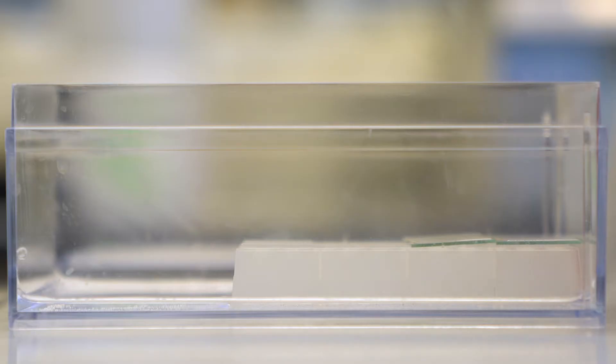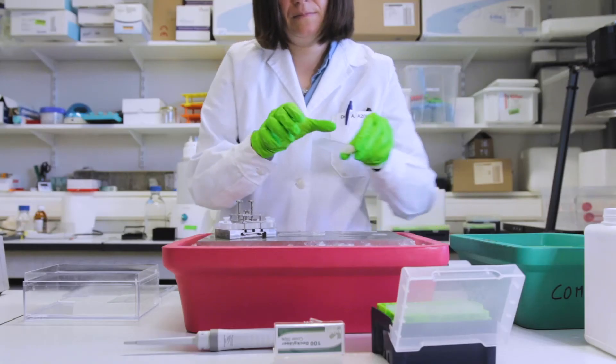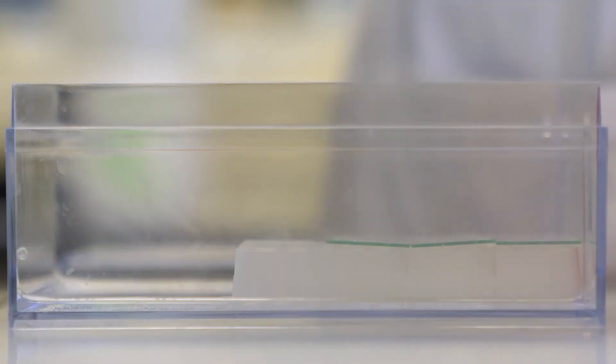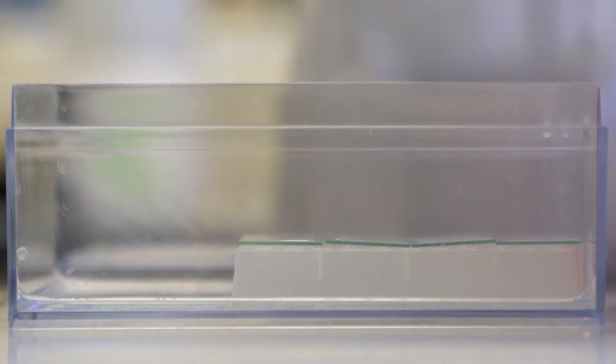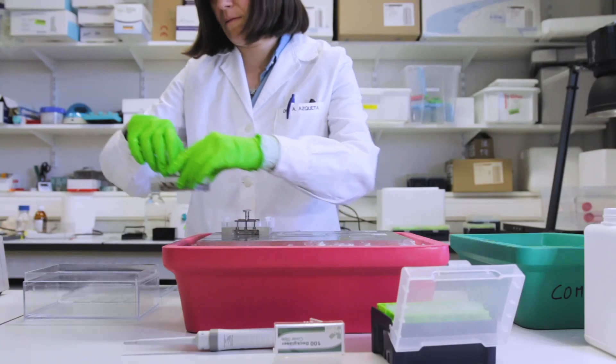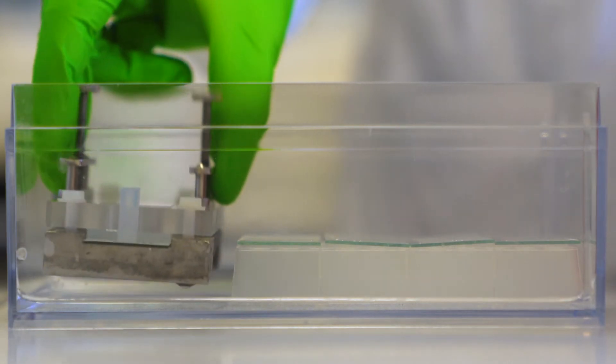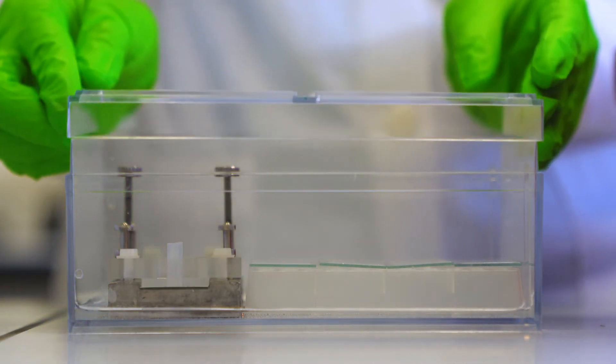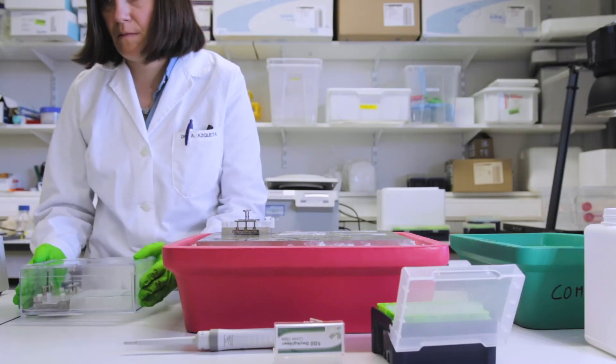Ideally these boxes have been in the incubator before you start using it so that it's already pre-warmed. And also a 12 channel system could be placed in such a box. And now we will move this box into an incubator of 37 degrees.